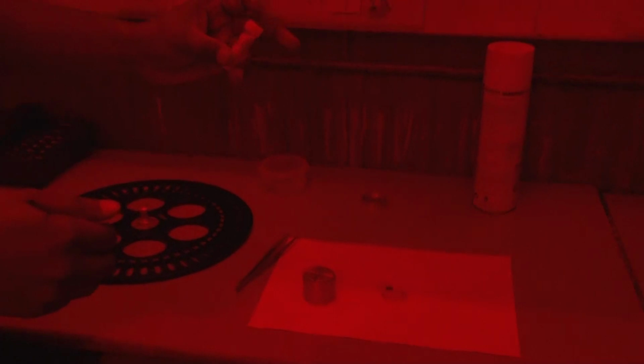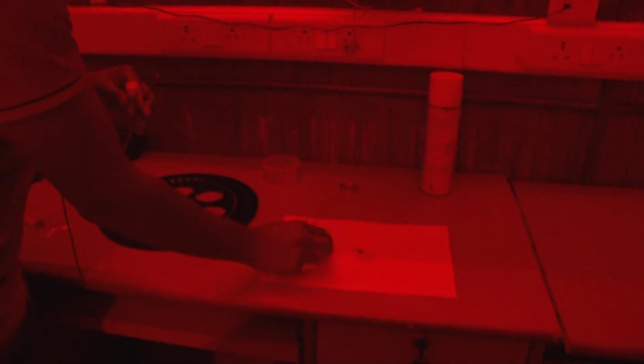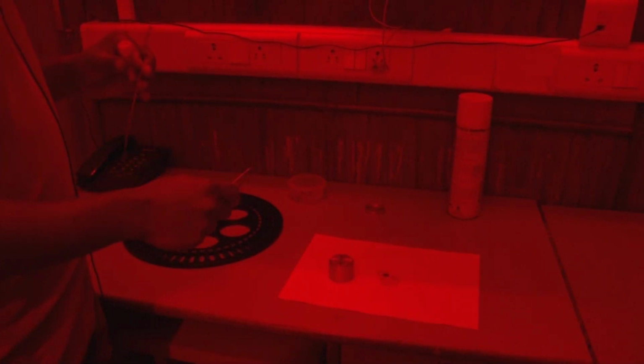This is the sample, greater than 90 micron and less than 125 micron. We will put this sample on the disc. This is called the spacer, and it is useful to prepare the medium-size quartz aliquot.